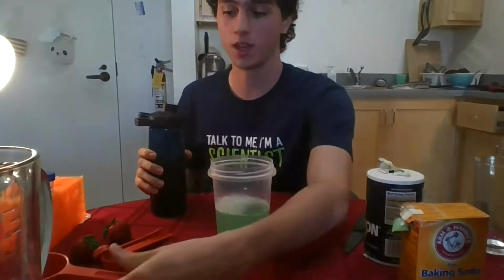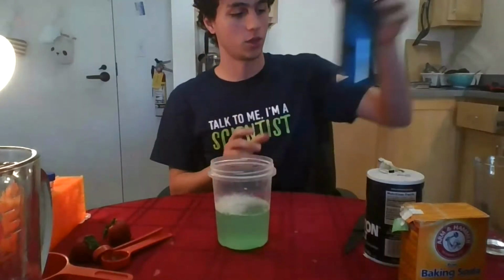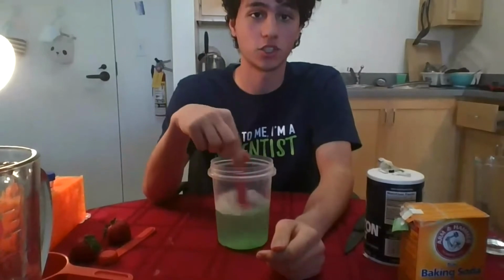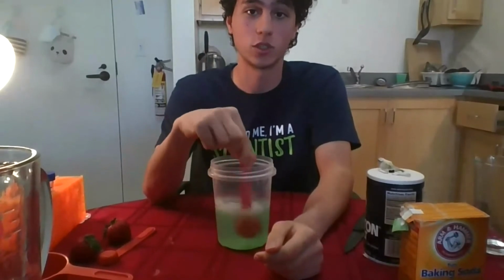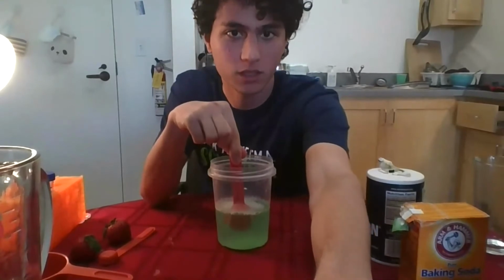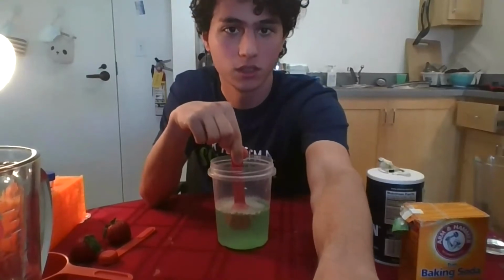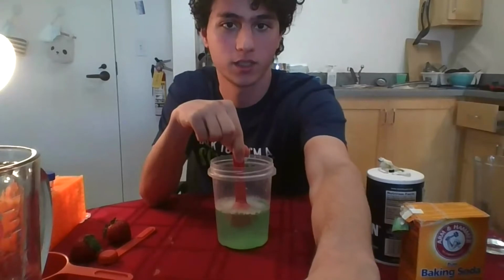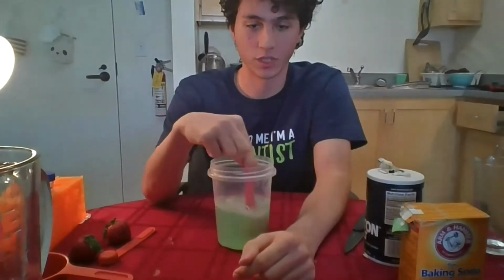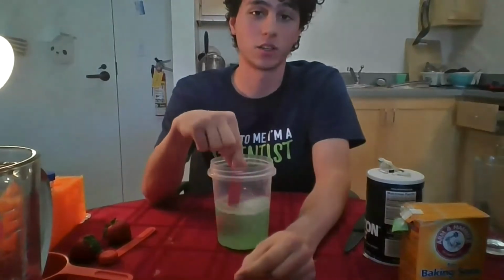That's what's going to allow us to extract our DNA. And we have to stir it for a couple of minutes. And in the meantime, maybe we can launch another poll asking whether you have been able to do this. I think we have that poll, right? That's the next poll. Okay, that's actually not the next poll, I'm sorry. So we'll continue mixing for a couple of minutes, and maybe in the meantime, Gabriela can tell us what's the next step.